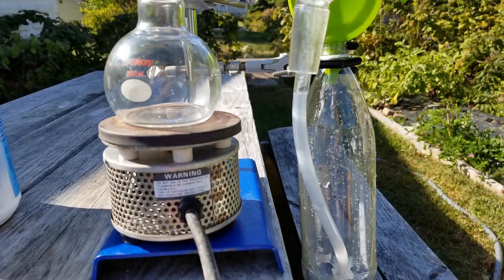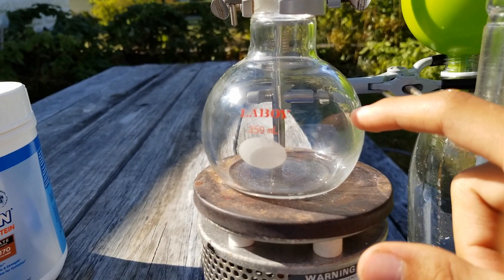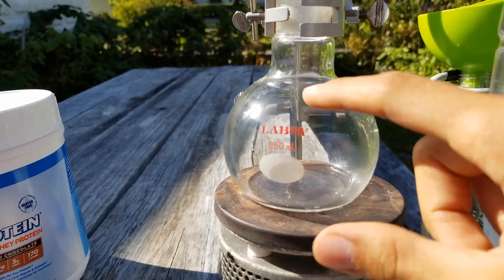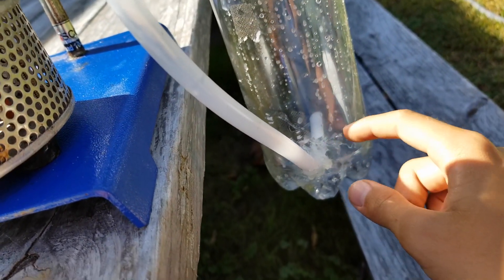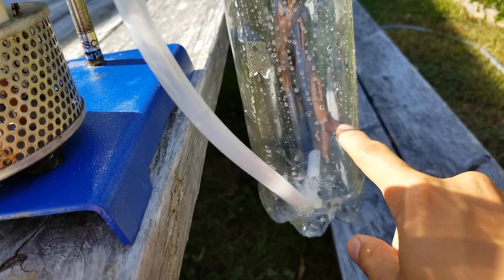The way this setup works is actually really simple. You just have this area filled with hydrochloric acid, and then you add a hygroscopic salt. In this video I'll be using calcium chloride, which will destroy the azeotrope. So then you can boil off the hydrogen chloride, bubble it through this system, and then the hydrogen chloride will bubble through more hydrochloric acid and be dissolved.